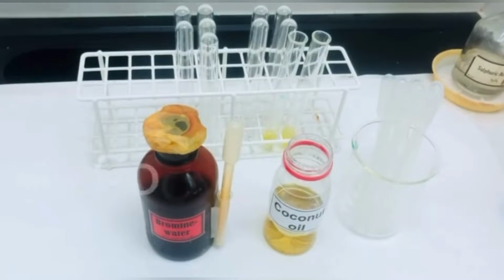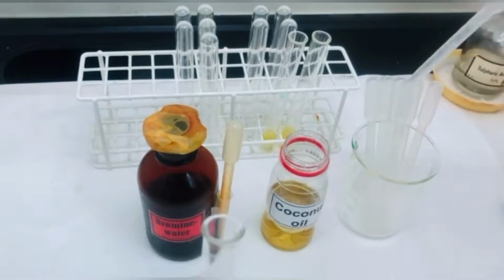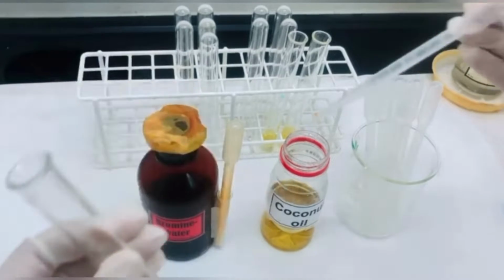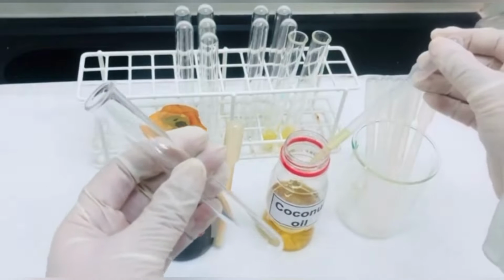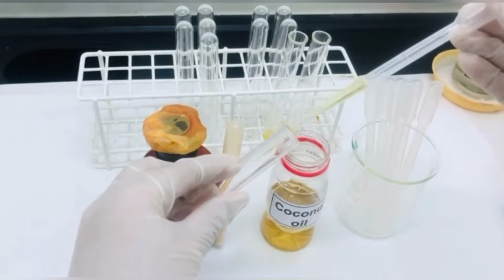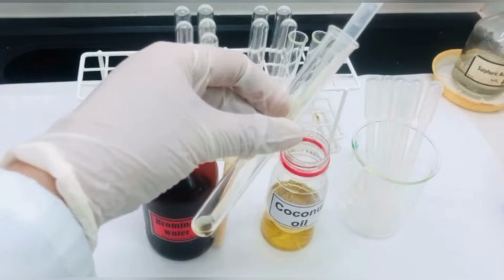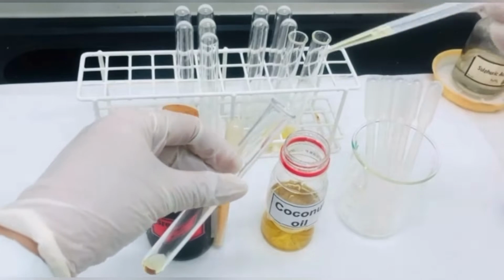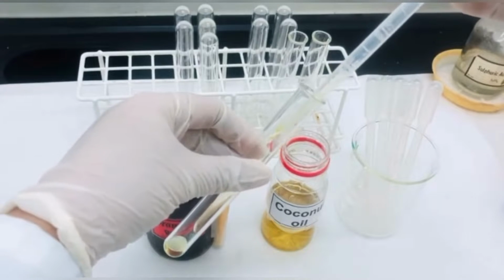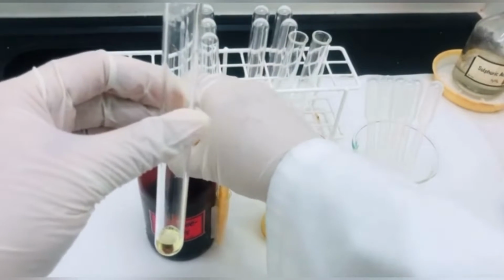The next sample that we are going to take is coconut oil. So we will take around 1 ml of the coconut oil in a test tube and put a few drops of bromine water.